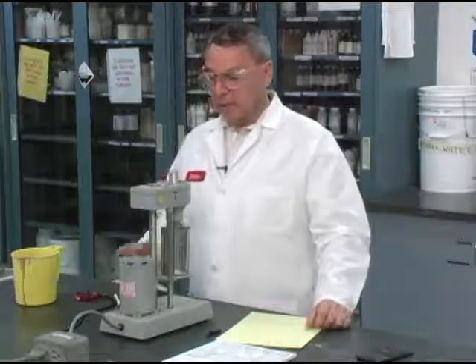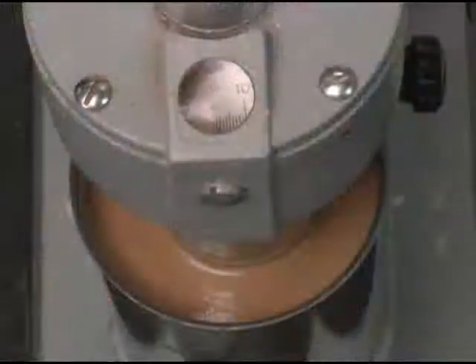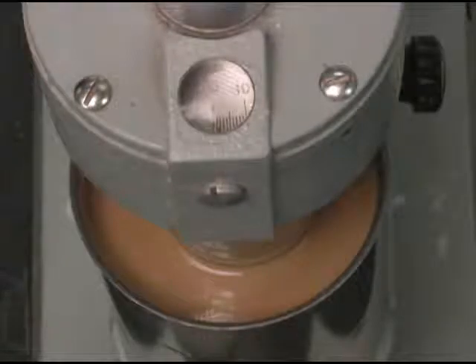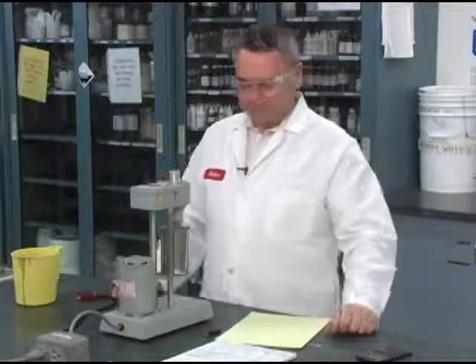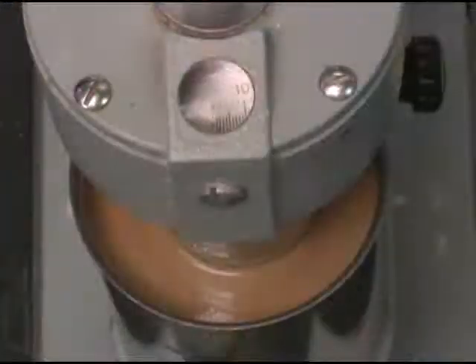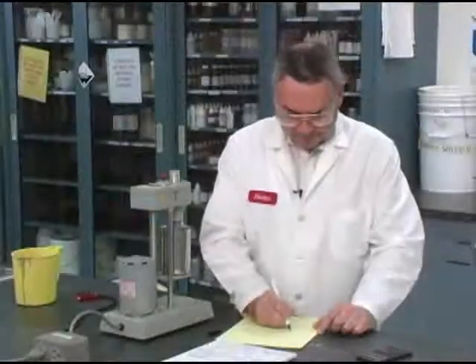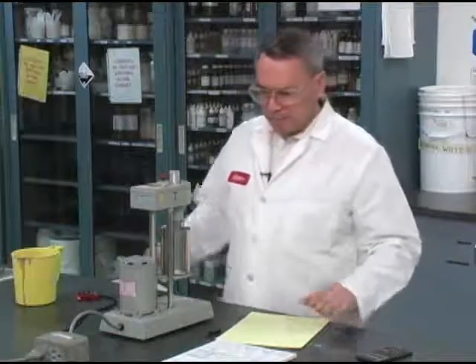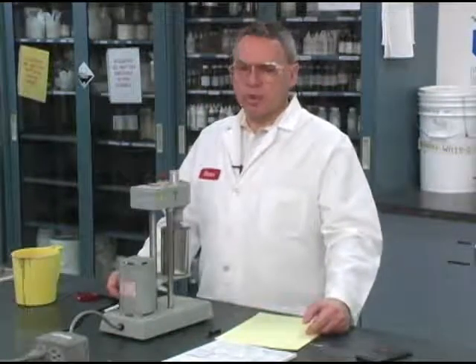What I can do now is go to the low speed, same gear. Now this is moving very slowly. I'm going to imitate it with my hand. 3 RPM. And I can see that the dial reading comes to 2. So I have a complete set of data for rheology determinations.